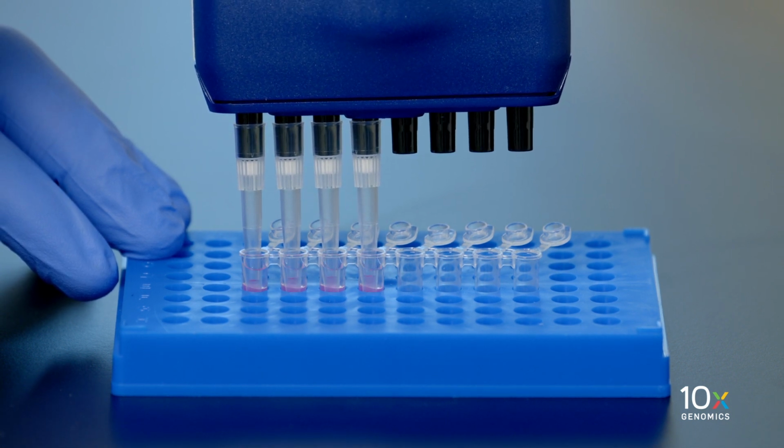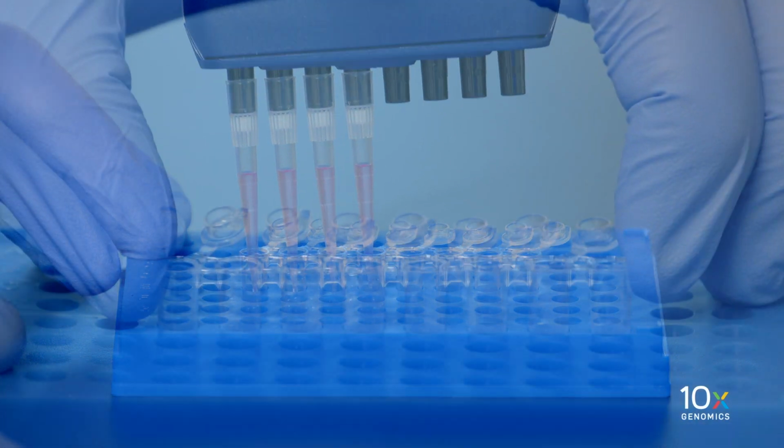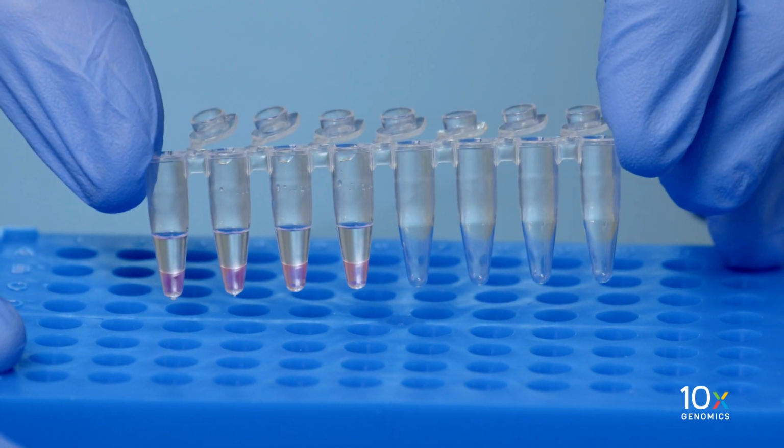Slowly remove and discard 125 microliters of recovery agent and partitioning oil from the bottom of the tube. A small volume of pink solution should still remain in the tube. Do not aspirate any aqueous sample. We have broken the GEMs with recovery agent, and now we're ready to proceed with the Dynabead cleanup step.